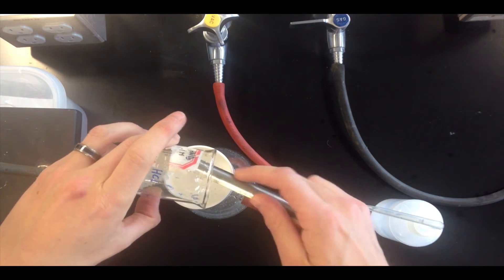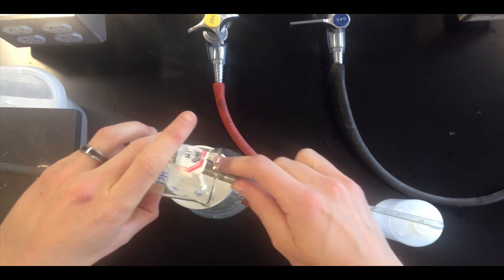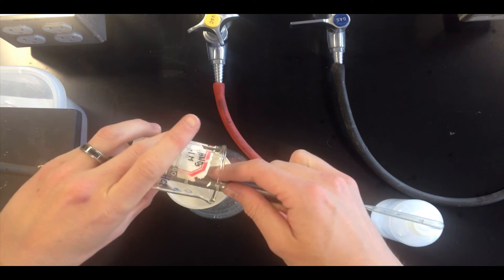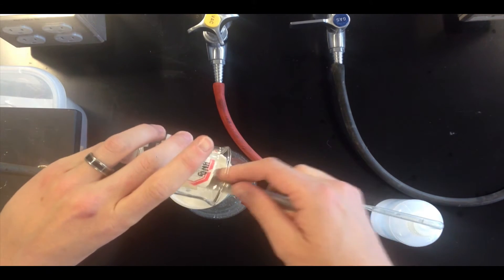So initially, and this is fairly common depending on the nature of the solid, it's pretty much all liquid, and so I'm using a spatula to scoop out the remaining crystals.